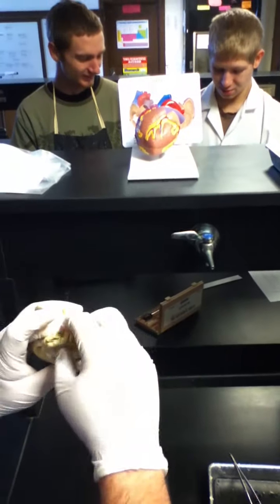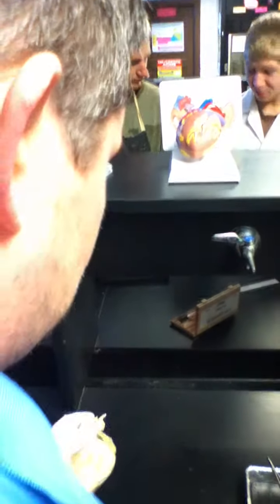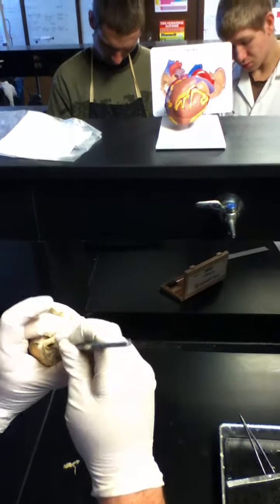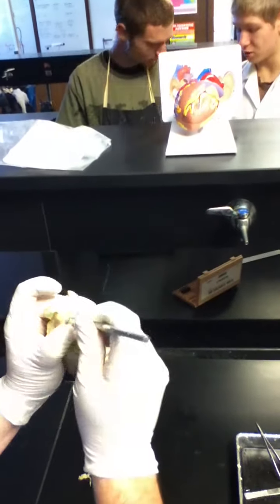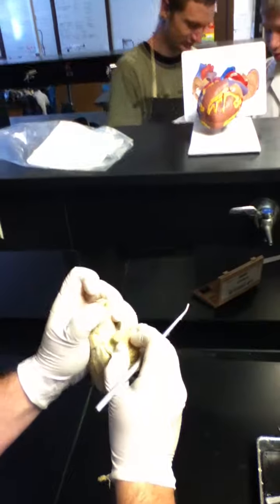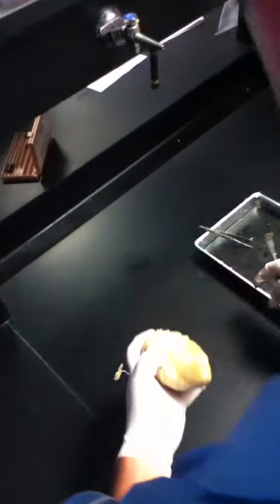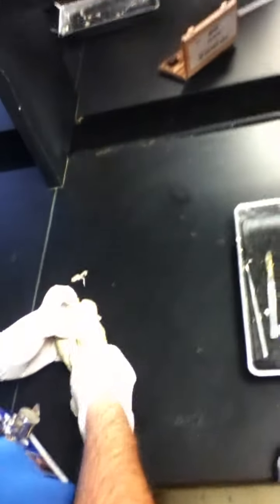Okay, here we go. Let's get some of this fat off of here. Get the scalpel. All right. This is good stuff. I'm getting this live. Let's go ahead and cut this. Are you cutting into the heart? Mm-hmm. Right atrium down to the right ventricle is probably the best way to do it. And then to get to the left side, just go through that? Mm-hmm. So we're just going to split this.